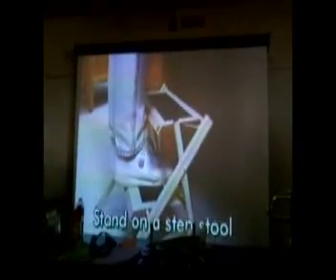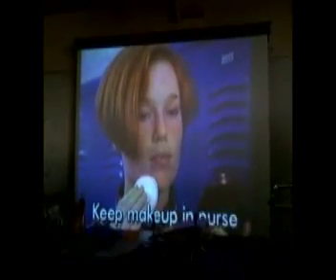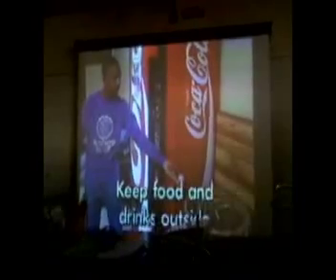Take off all your clothes. Don't let modesty make your injury worse. Your teacher will clear the other students out of the room. Stay under the shower for at least 15 minutes.